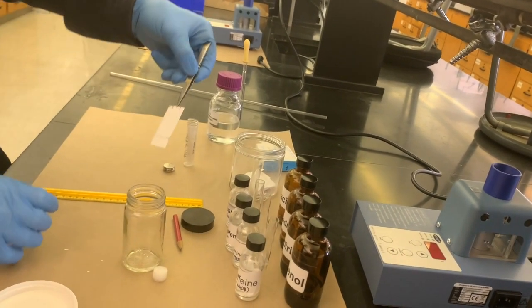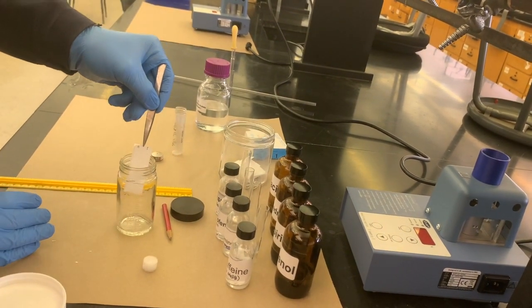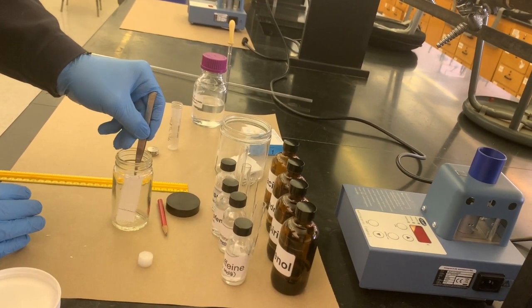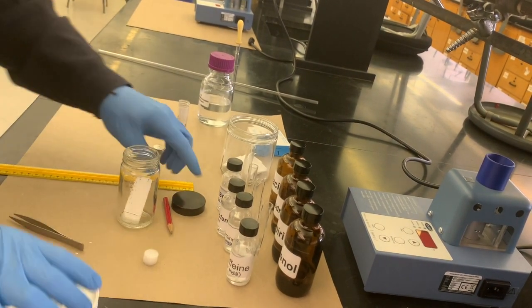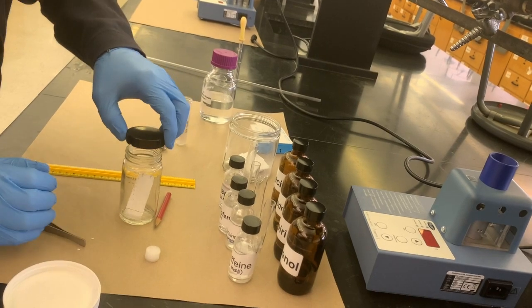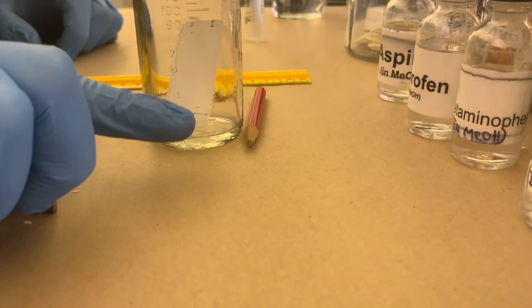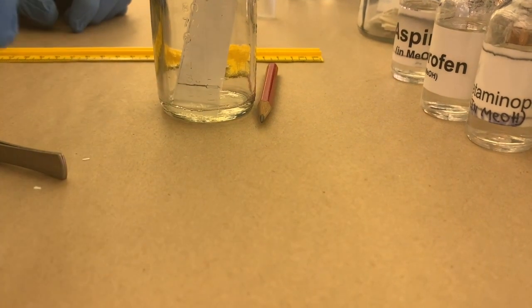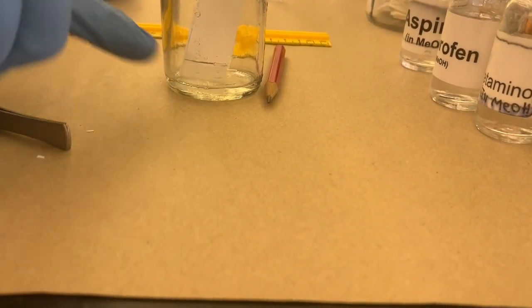So here we go. We're going to take our sample and place it in the TLC chamber. And you're going to let it sit down slowly. And once it is going, you are ready to start. Already you can kind of get closer here and see that it's moving unevenly. Hopefully that won't cause any problems. Ideally, it would move in a perfectly even flat line. But even that small defect in the corner is causing some uneven diffusion. So hopefully it's not too bad.